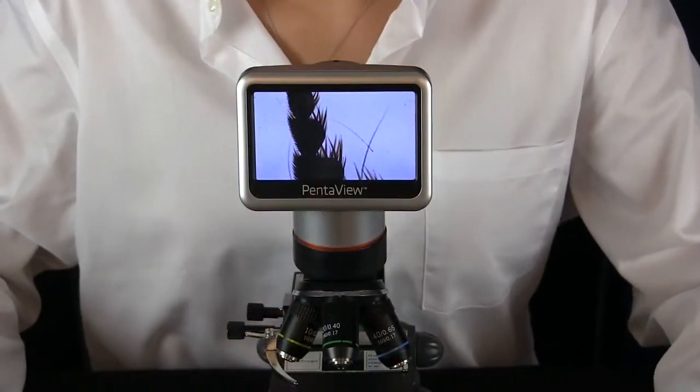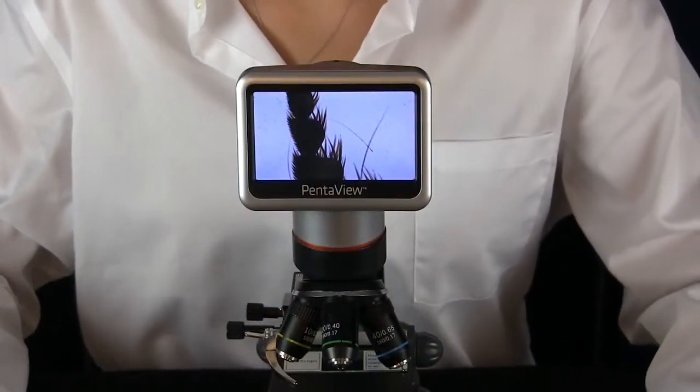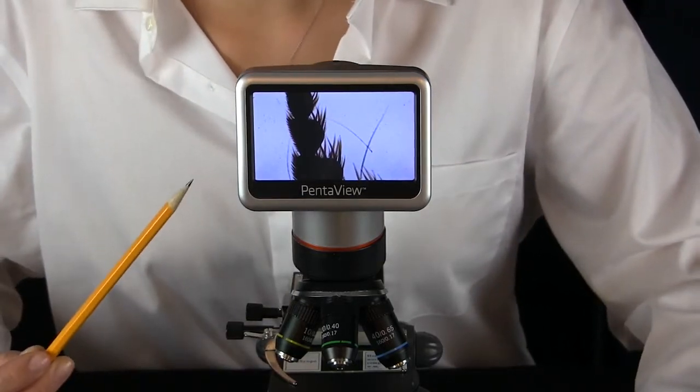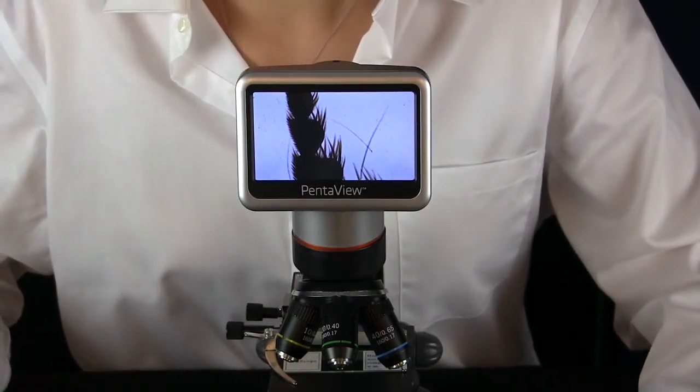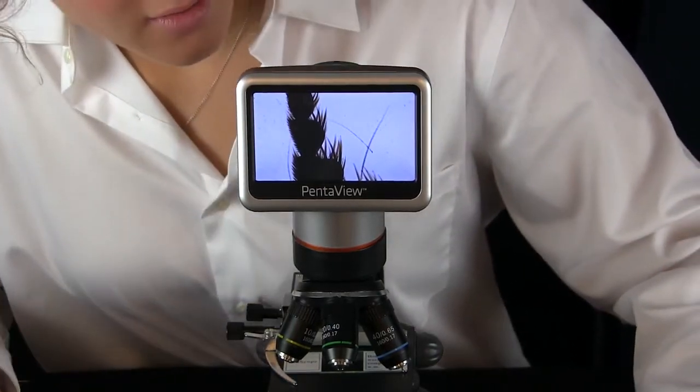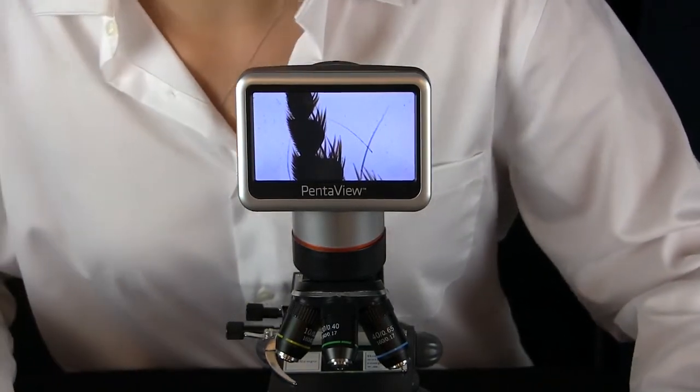It's the leg of a honey bee. Let's take a look at it under this microscope. We've put the slide with the leg of the bee into the microscope, and look — the picture shows up here. I didn't know there were hairs on the leg of a honey bee. Did you? And look how big they are. Wow, this microscope is so cool. This bee leg is made of cells but we can't see them because they're too small.